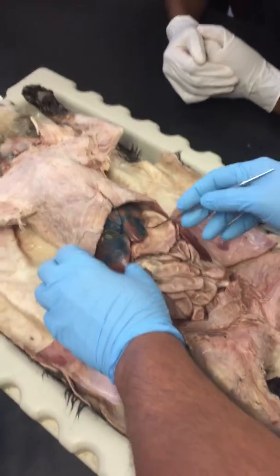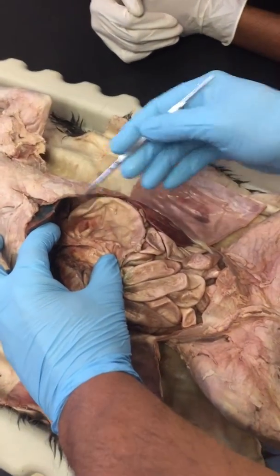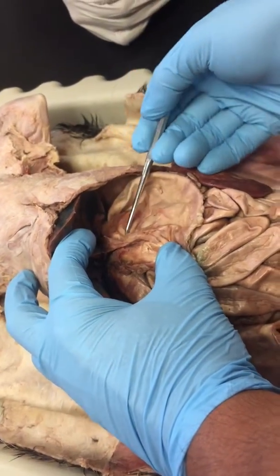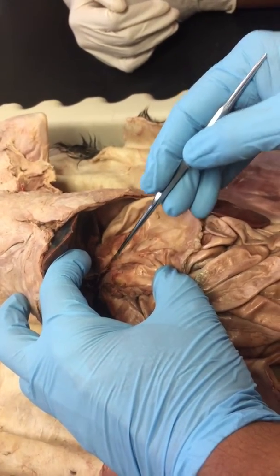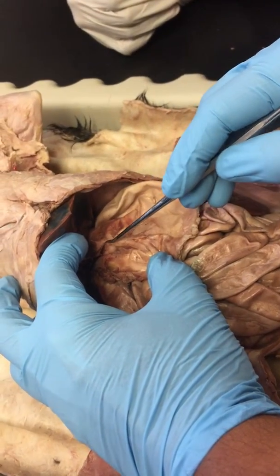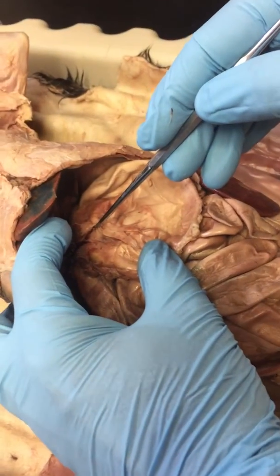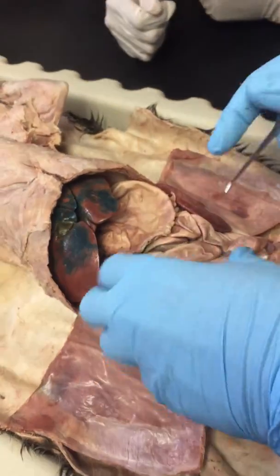is going to help you then with the lesser omentum, because the lesser omentum is attached to the lesser curvature of the stomach. This is the stomach right here. This is the greater curvature. This is the lesser curvature right here, okay? This membrane, which kind of looks like it goes between the liver, this lobe of the liver here, called the caudate lobe, and the lesser curvature of the stomach, that is called the lesser omentum, okay? So greater curvature, greater omentum. Lesser curvature, lesser omentum, okay? So that is that membrane.